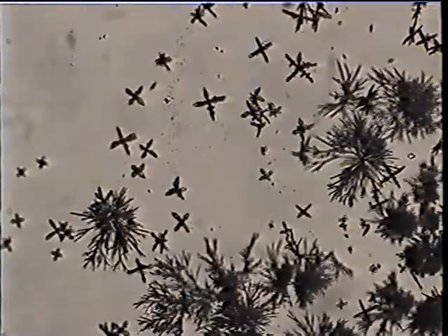This is a chemical reaction between zinc ions in solution and a reagent, potassium mercuric thiocyanate. We see druzy crosses here. These druzy crosses are characteristic of the presence of zinc in the solution. This is a similar reaction with the same reagent looking for copper. And the crosses that we now see are actually the zinc crosses that contaminate this particular solution.